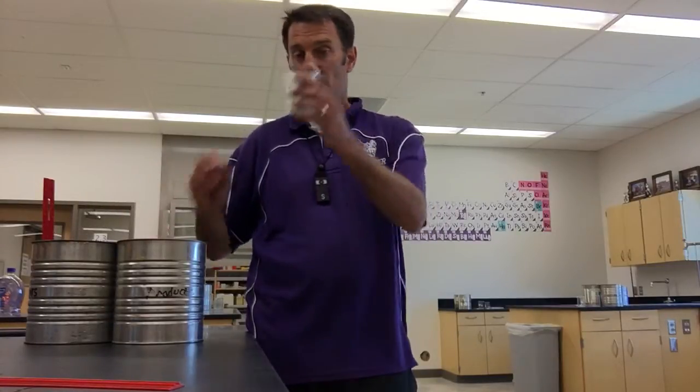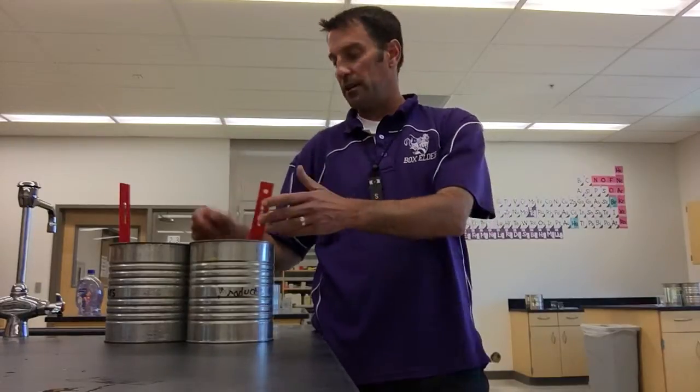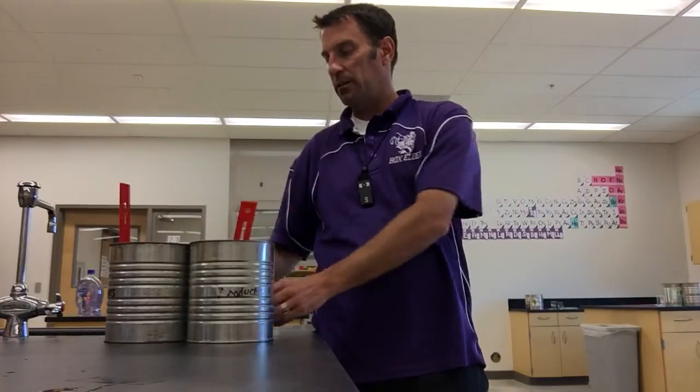And then it says use the 250 beaker for the forward reaction. That means from reactants to products. Do I have that right? Does that say reactants? All right. So I record my initial height, then I fill this one up, pour it over, and then I get the smaller one for the reverse, fill it up, pour it over, and then I remeasure both heights in centimeters. And I do that again, big that way, little that way, measure again, and I stop when the numbers don't change for 5 times in a row.